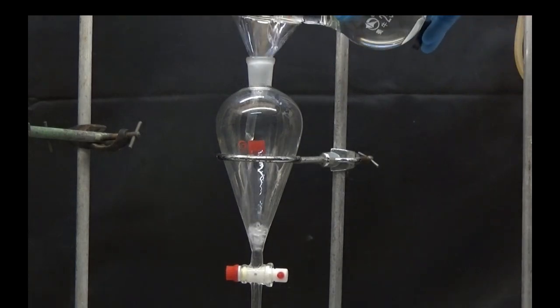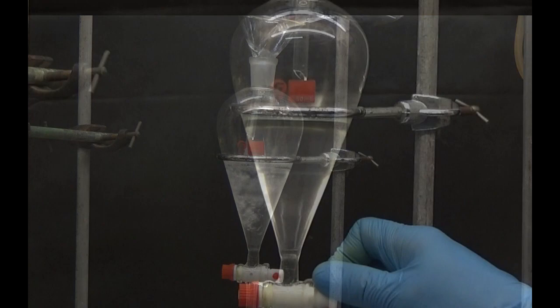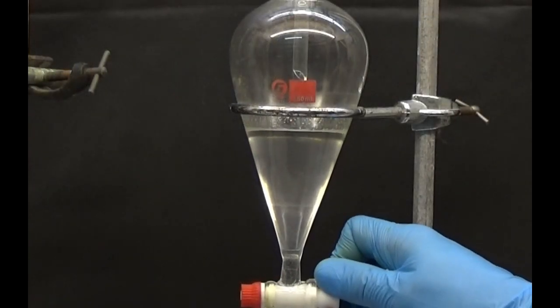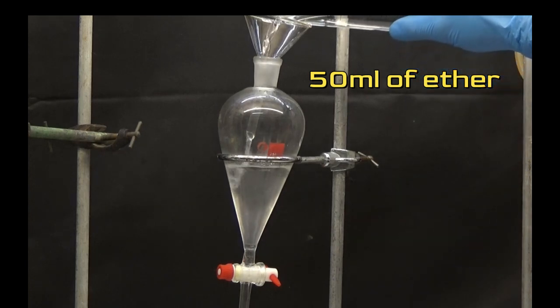Decant the organic layer. Wash the aqueous layer with 50 milliliters of ether.